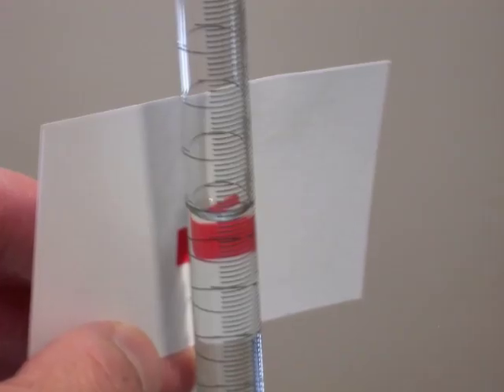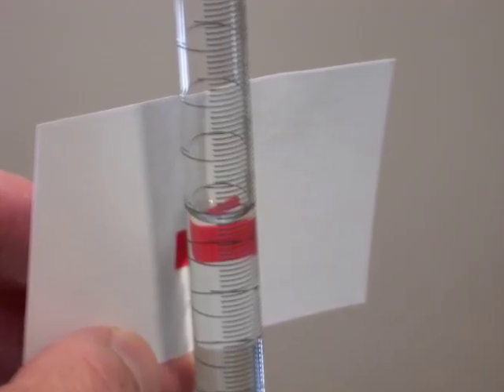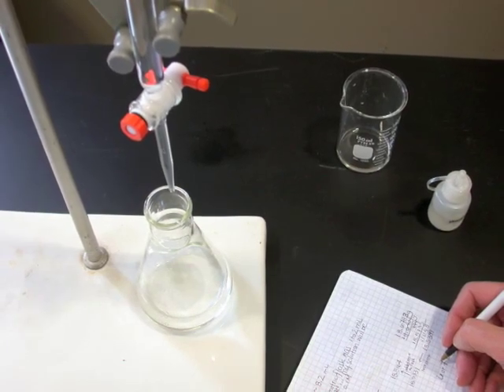Finally, carefully read the ending volume and record it to the nearest hundredth of a milliliter in your laboratory notebook.